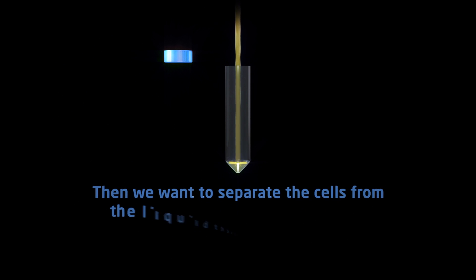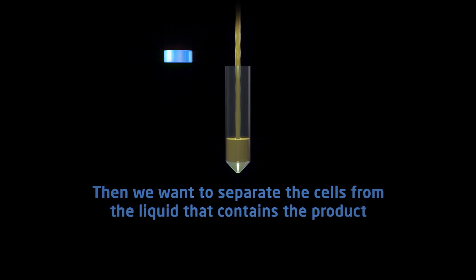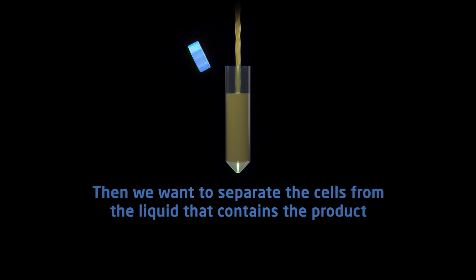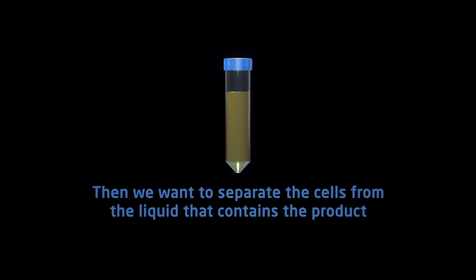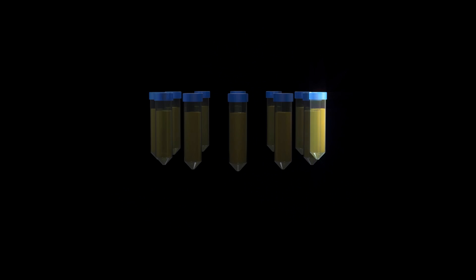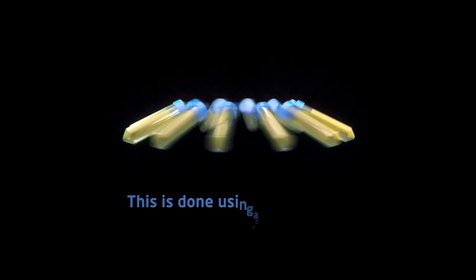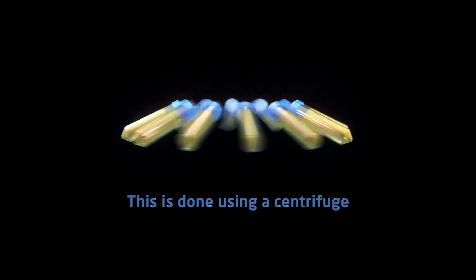Then, we want to separate the cells from the liquid that contains the product. This is done using a centrifuge.